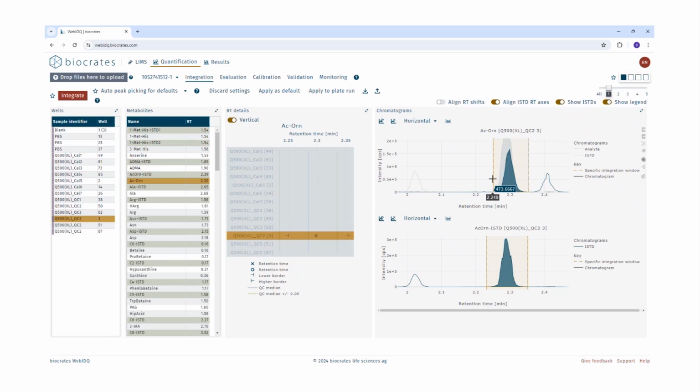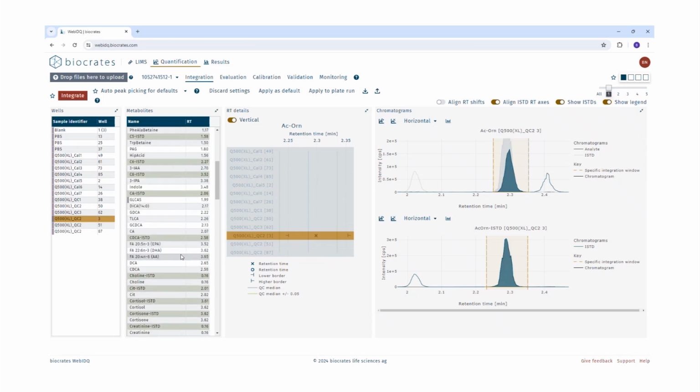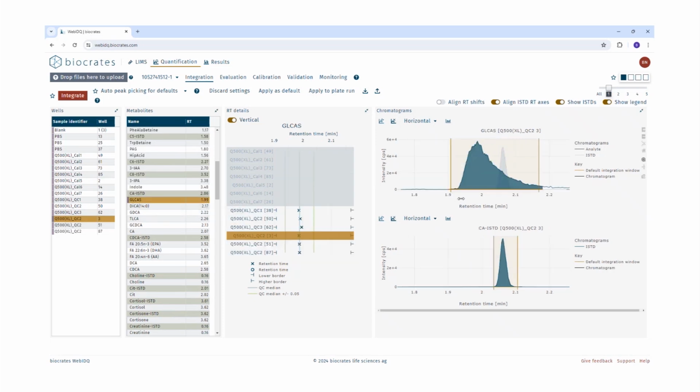So now the time for the third tip. It is generally a good practice to quickly cycle through all the metabolites to make sure that the right integration windows are defined. We can check also here another example where the confidence indicator is active, for example this metabolite. And we can see here that the integration ranges are already defined, but still the confidence indicator is active. In this case, we would recommend to define wider integration windows so that the confidence indicator disappears. So cycle through all the metabolites to see if a peak is not correctly integrated or if the confidence indicator is still active, then please define the integration windows again or check if the peak is chosen correctly or not.